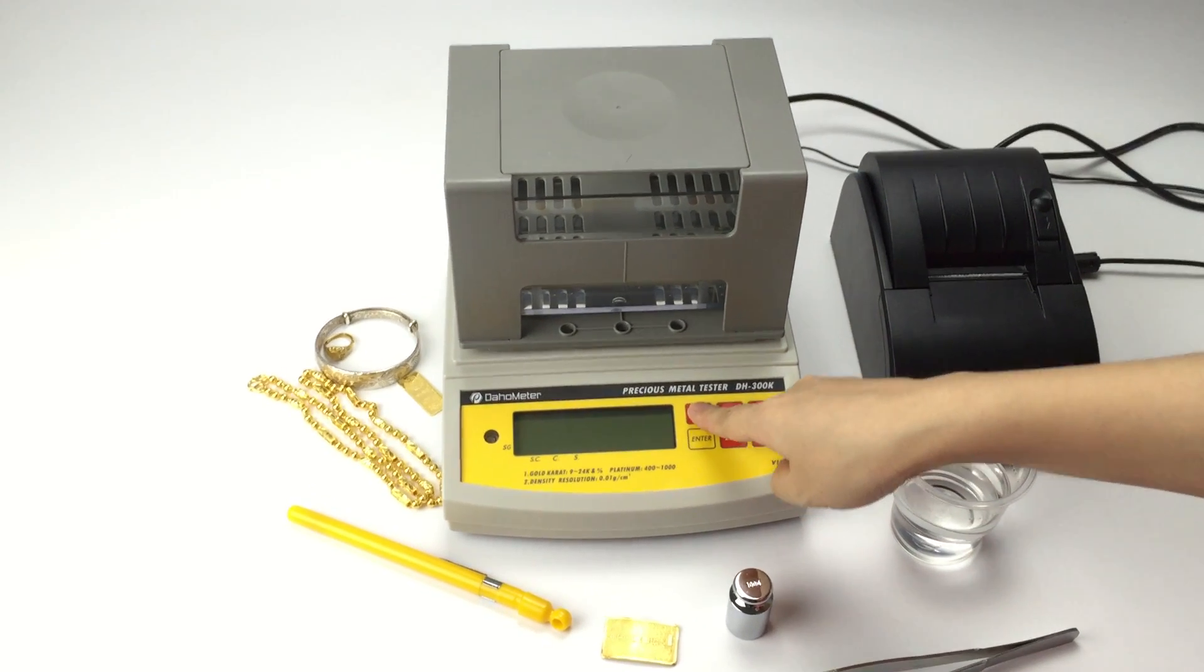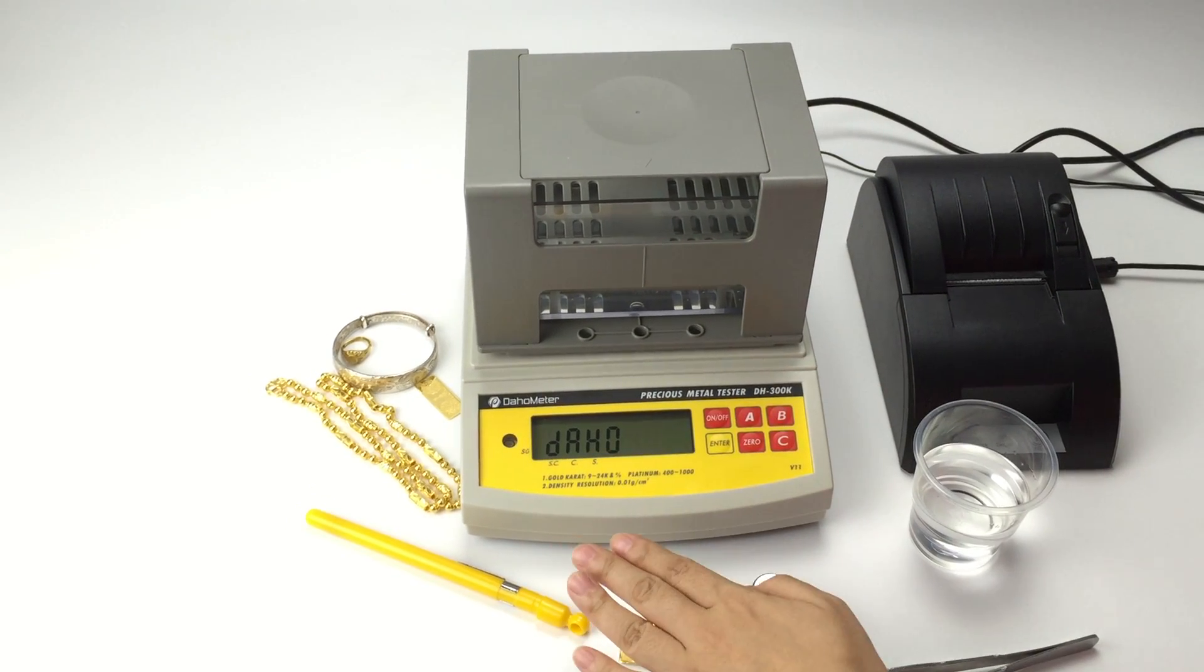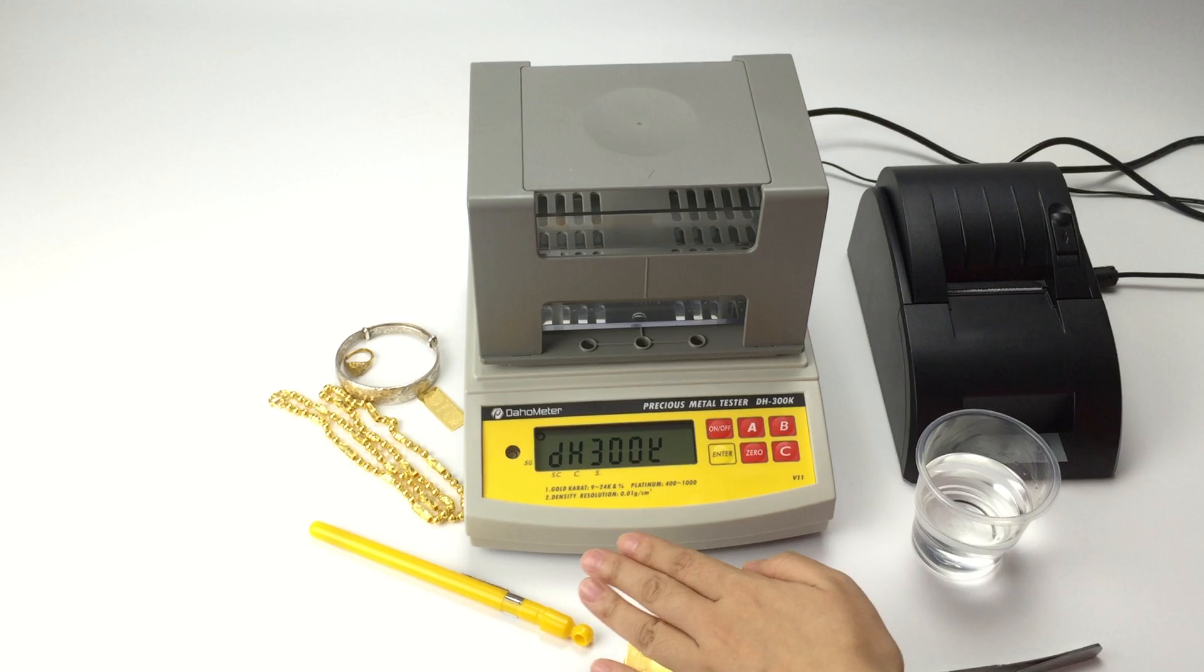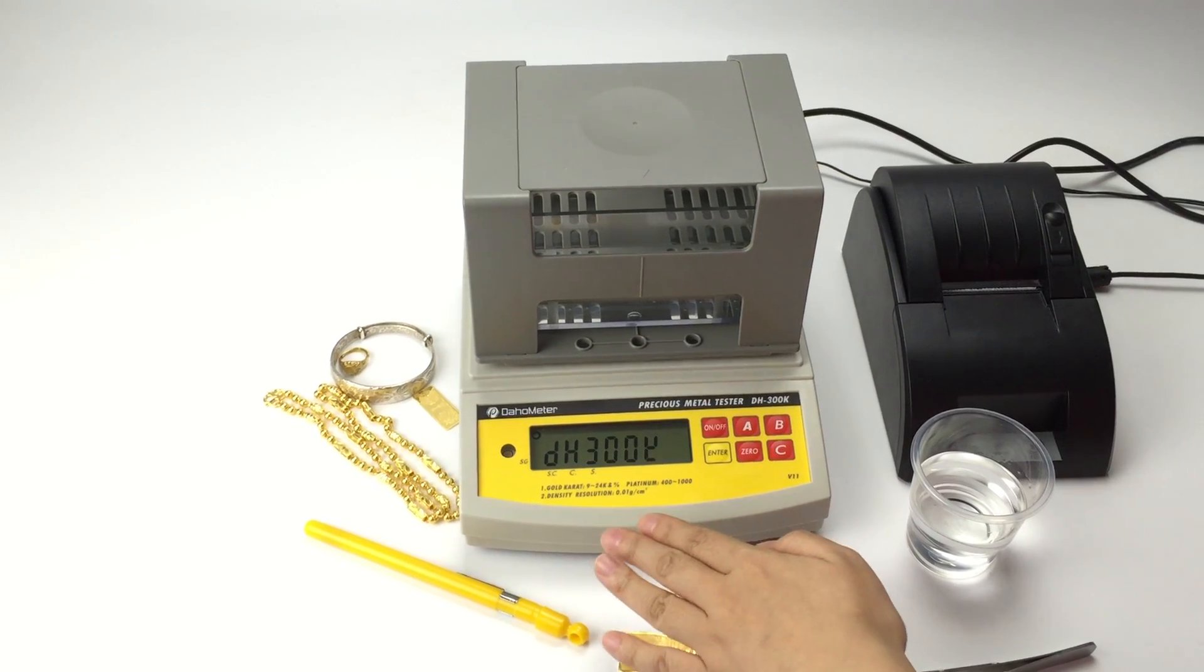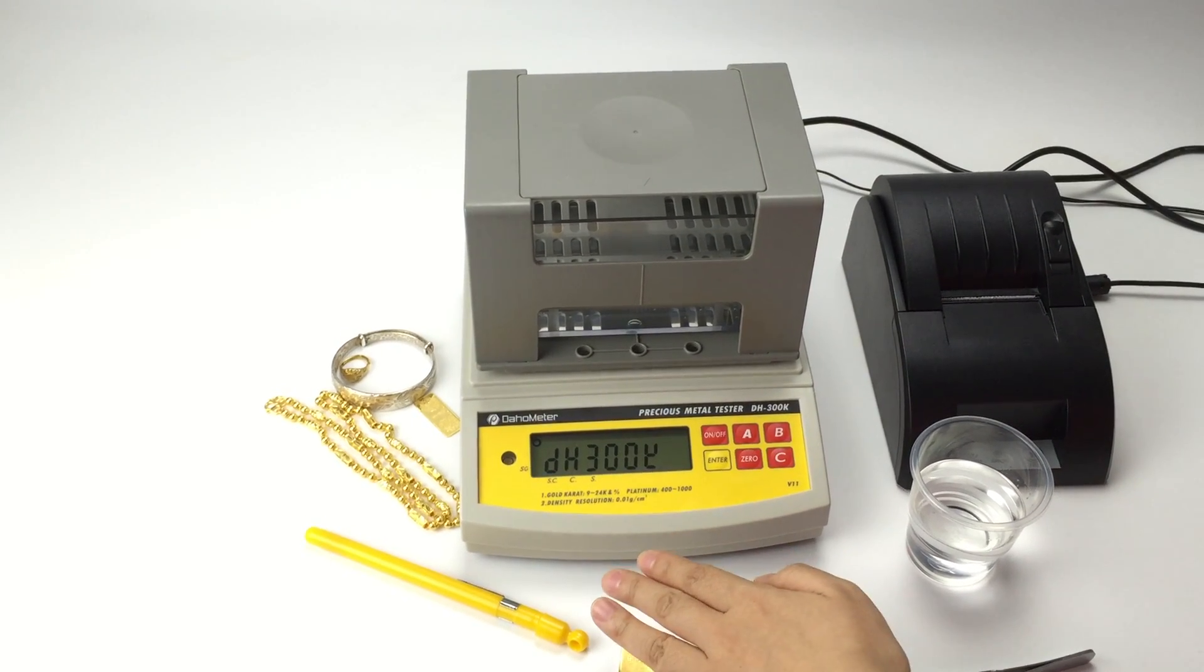Turn on machine. DAHO is our brand. DH300K is the name of model.